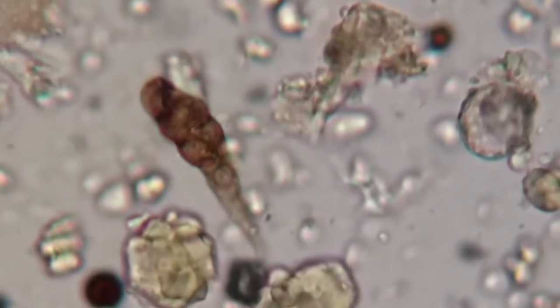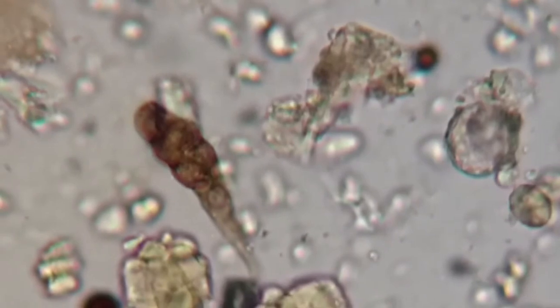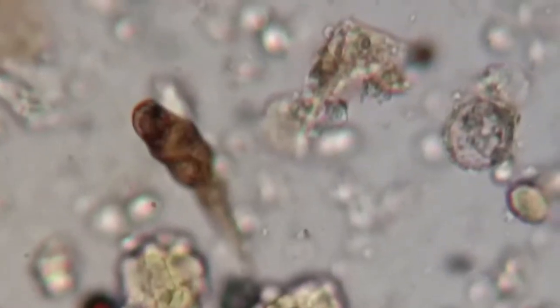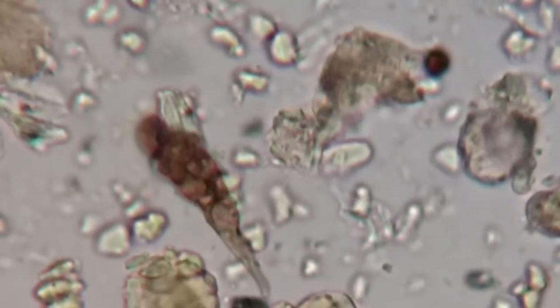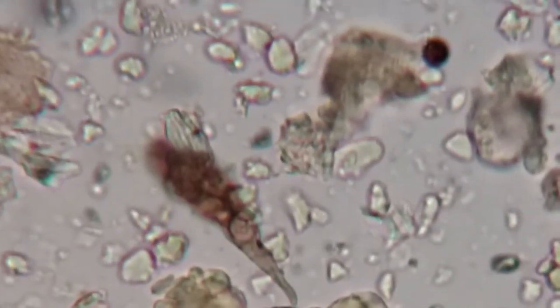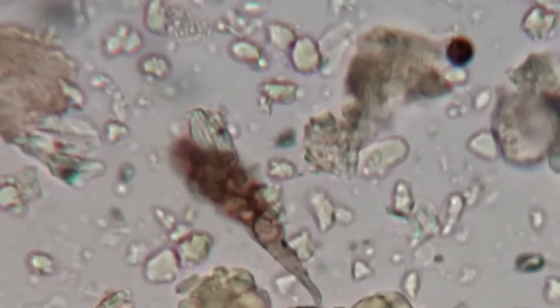You can't even focus on all parts of the same fungus in the same plane. As the club end becomes clear, we lose sight of the germinating tube. The point of that is that you're going to need to move up and down as you're looking at things.